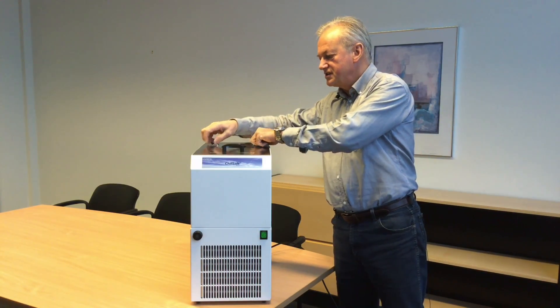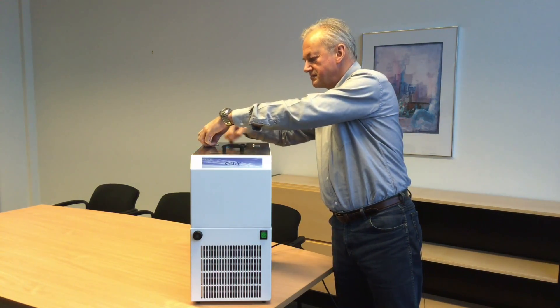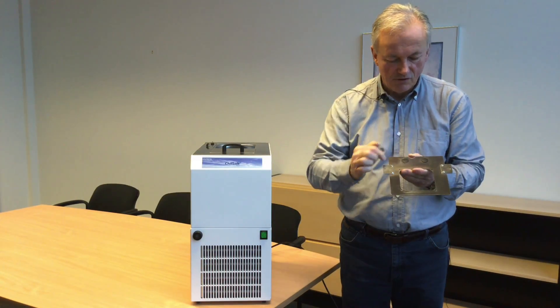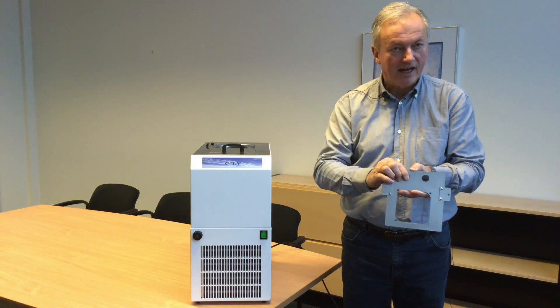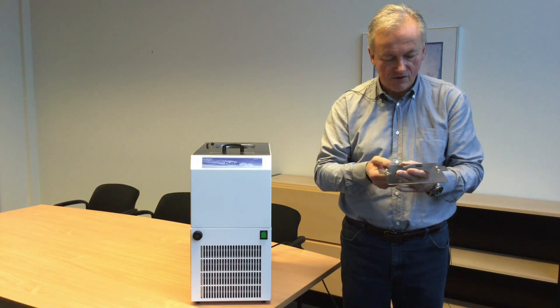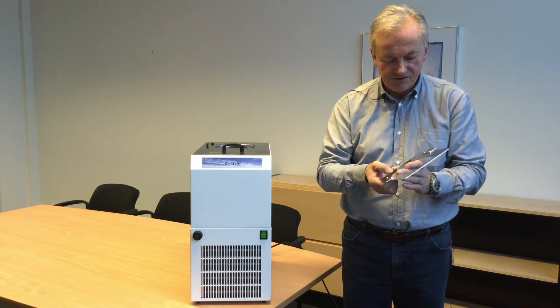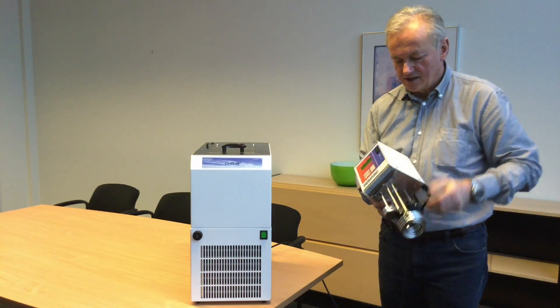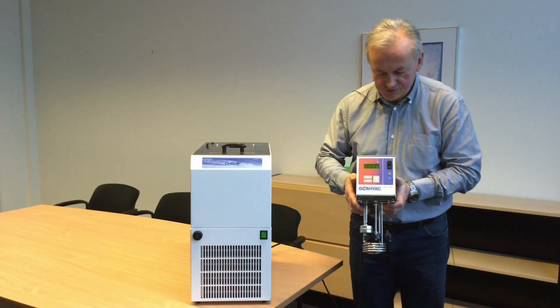And then we have a bridge for the thermostat itself. The bridge will fit for the thermostat. There are four screw holes and a black knob which you can take out in case you would like to have external circulation as well. The thermostat is a unit like this which will fit on the bridge — we will show you that later.